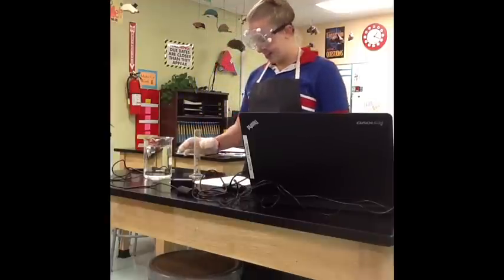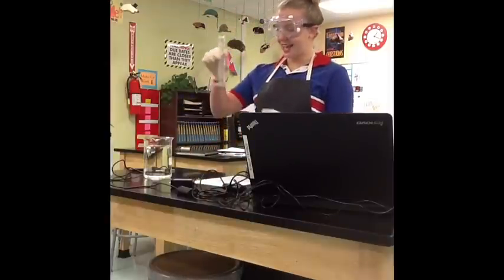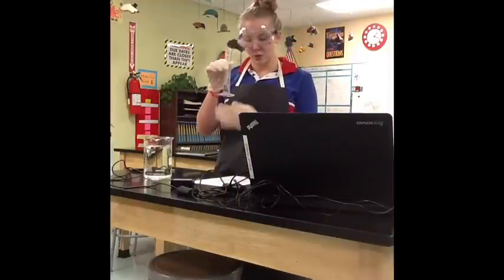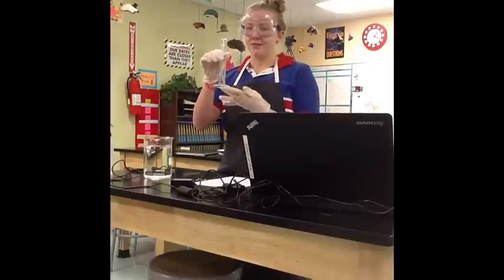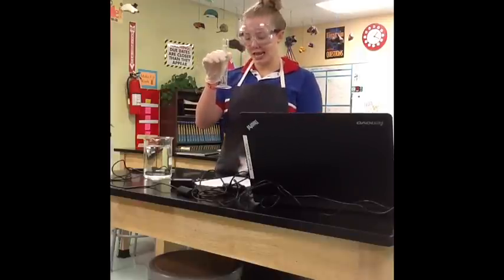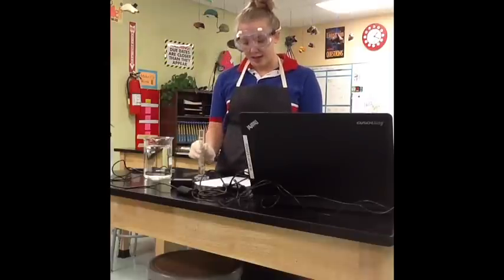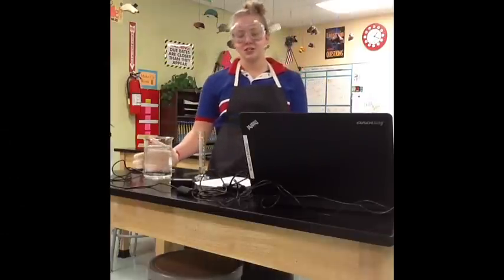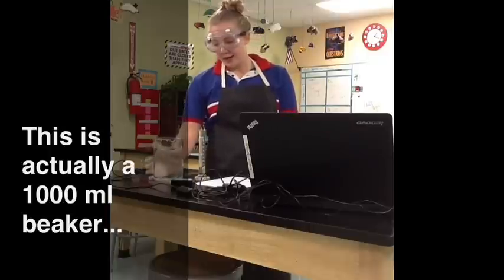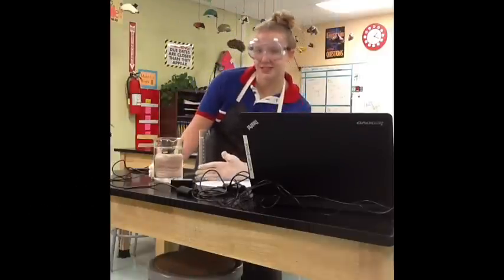So let's get started. You're going to start with 10 milliliters of our 3 molar HCl in a 50 milliliter cylinder, like so. You're also going to fill a 600 milliliter beaker with water up to this point.